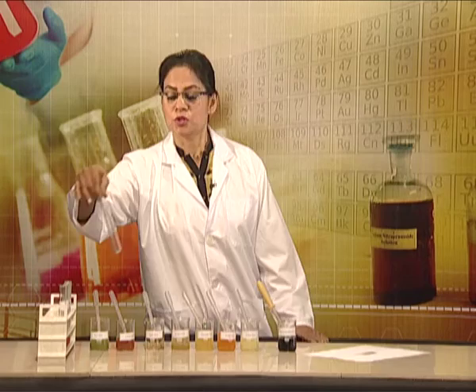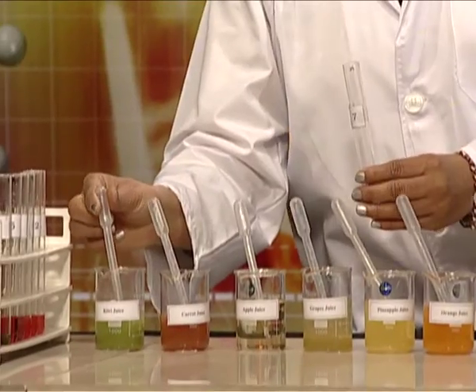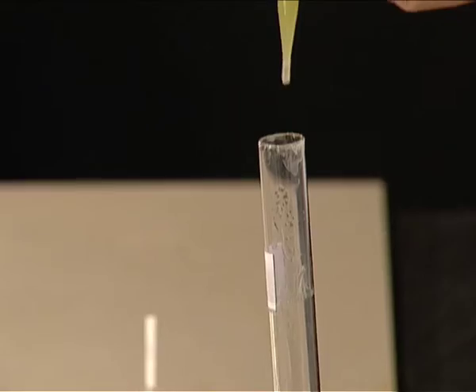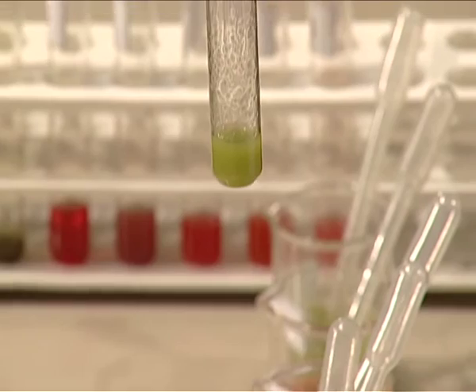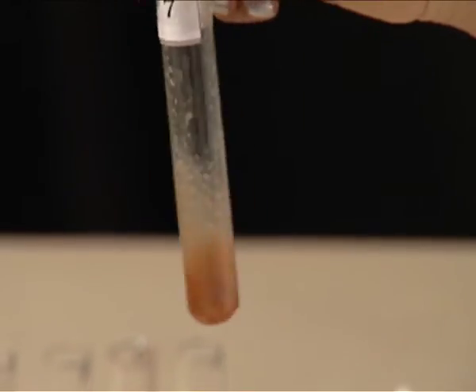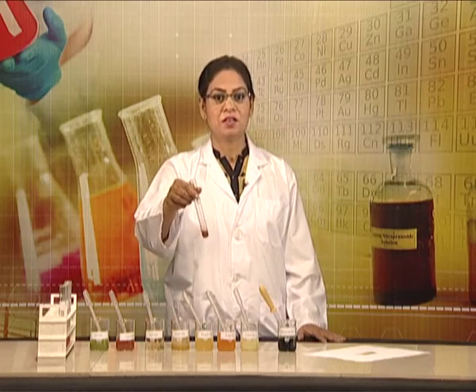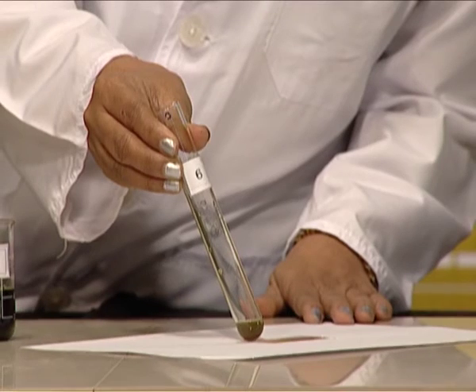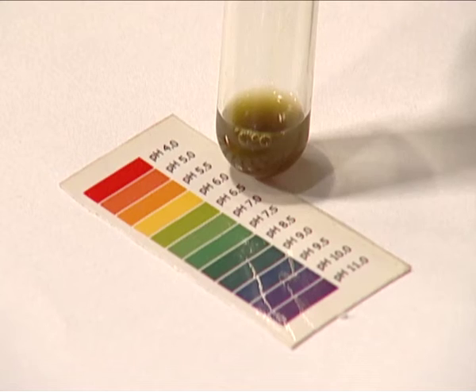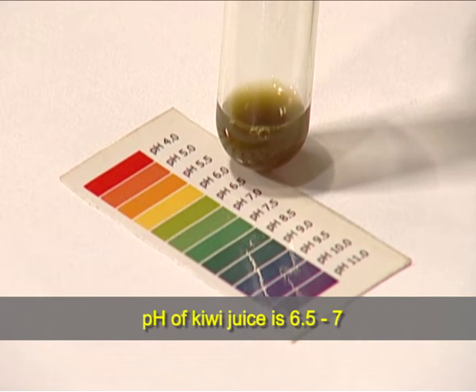Now, I am taking test tube number 7 in which I will take kiwi juice, adding 2-3 drops of universal indicator, shake it well. The test tube number 7 in which kiwi juice has been taken shows olive green color with universal indicator and pH around 6.5 to 7.